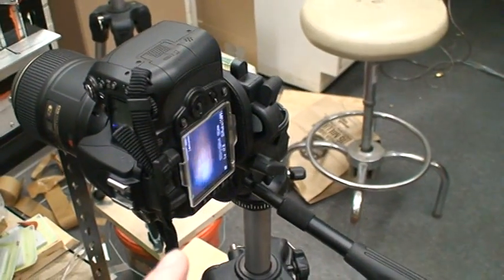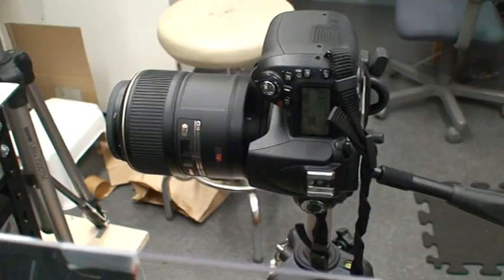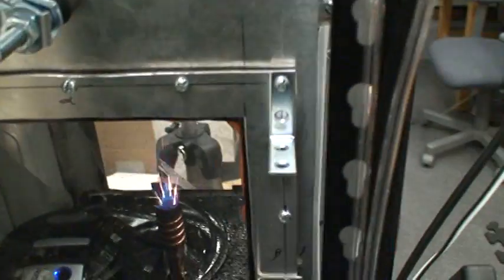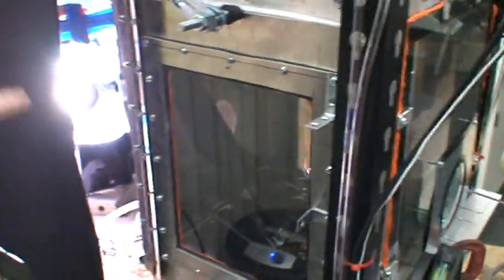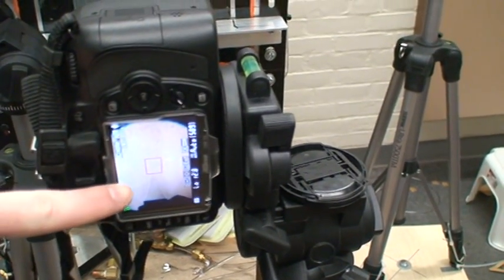This is recording video. This is a D90. So you want to open the macro lens all the way up out to its infinity focus. And then when we turn a light on, so we can turn our point source on there, you can see it quite bright. That's why we have this shroud, just so we don't go blind whenever we see it. Then you can see the shadow of the flame here.